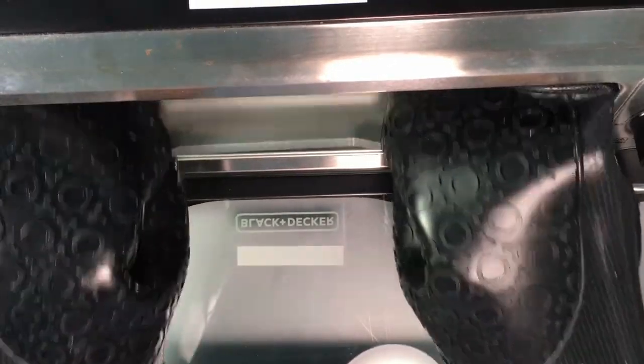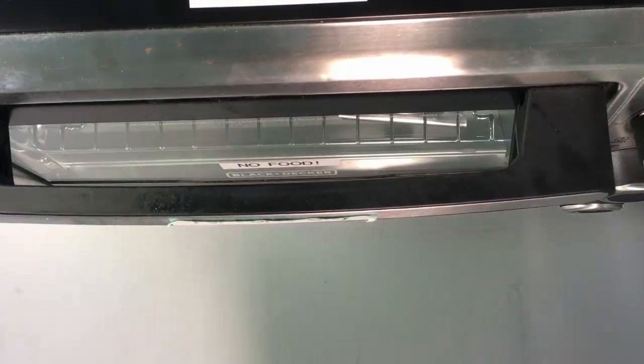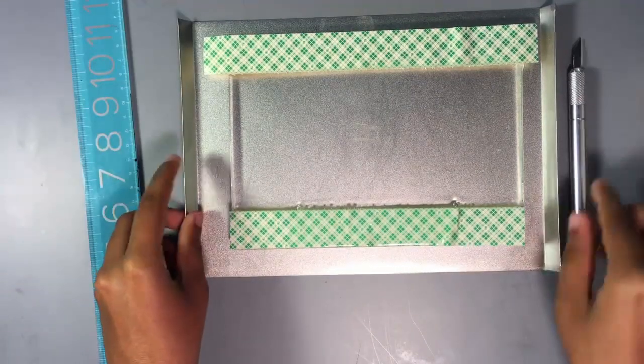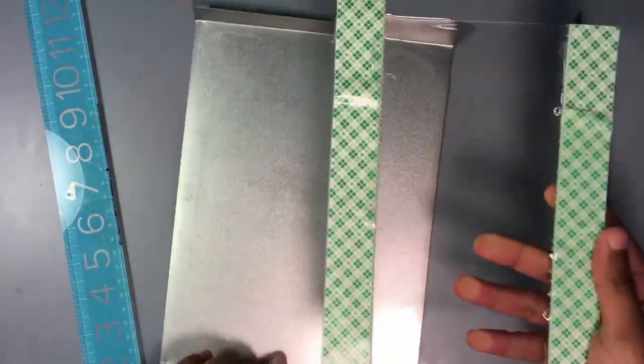After 1 hour, take the PDMS out of the oven and leave it to cool for at least 45 minutes. When the PDMS is cool to the touch, you may begin cutting it down to size.